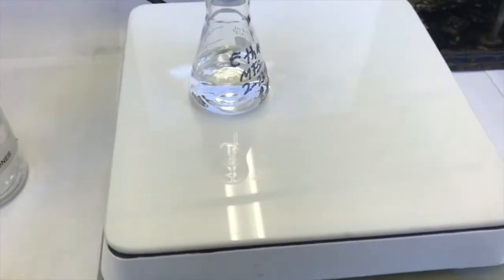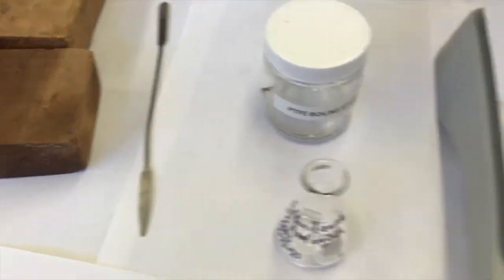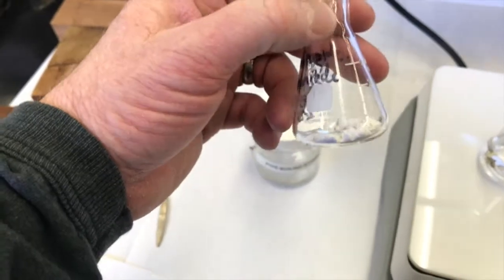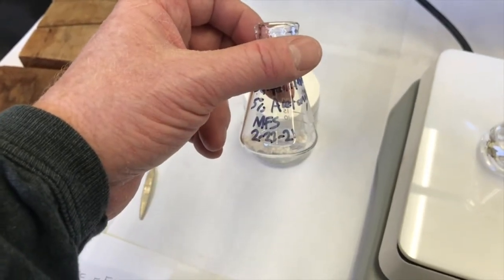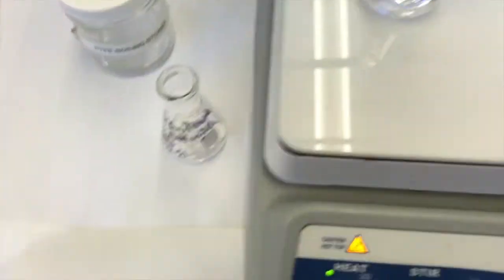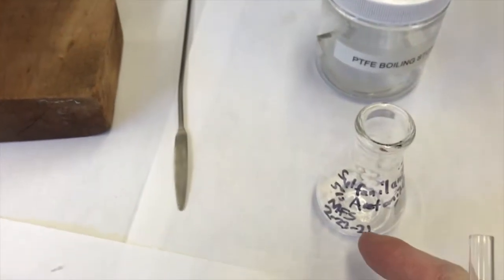Once it does, then I'm gonna use a pasteur pipette to pipette the boiling ethanol into my impure solid, and try to add the minimal amount of hot solvent to dissolve everything. This one I'm gonna try to dissolve all of the solid. It works out well, and then I'll let it cool and crystallize. As I add the hot solvent to the impure solid, it'll instantly cool. If this solvent is boiling and I add it over here, it'll be cooling in this flask.